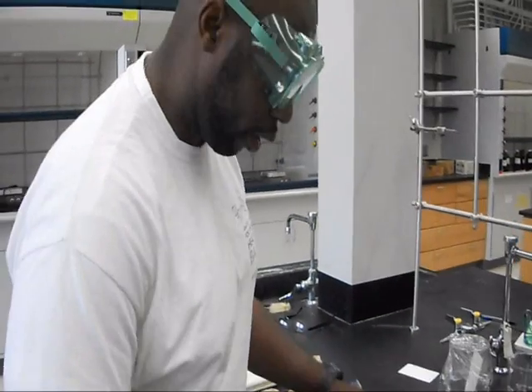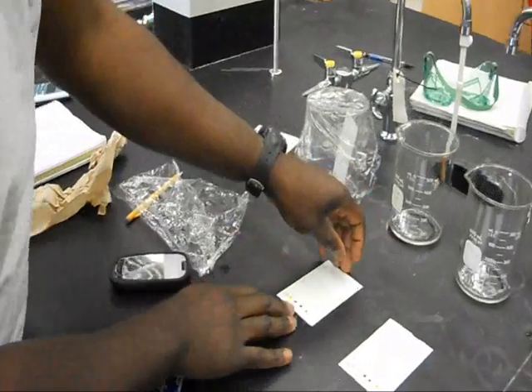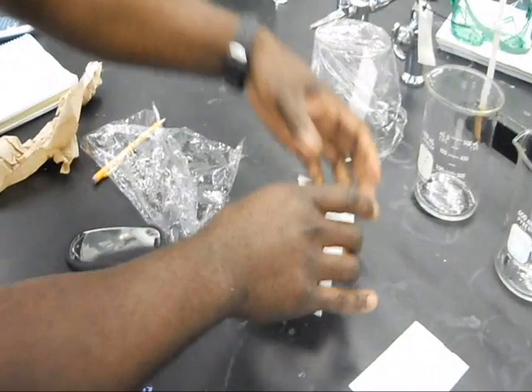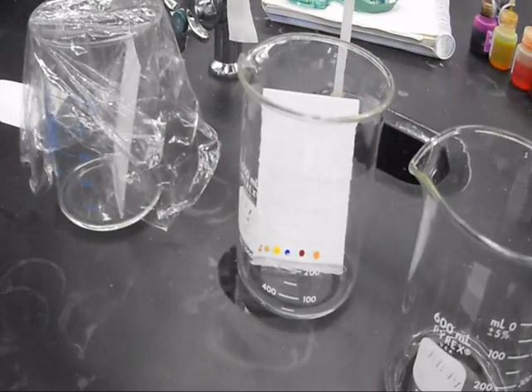Now we've got our six dyes into our capillaries and we're going to add them to our samples. Be very careful not to touch the side of the capillaries and insert it into the cup.